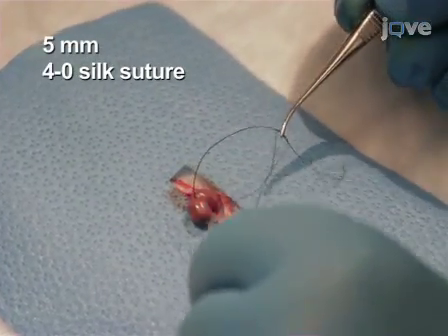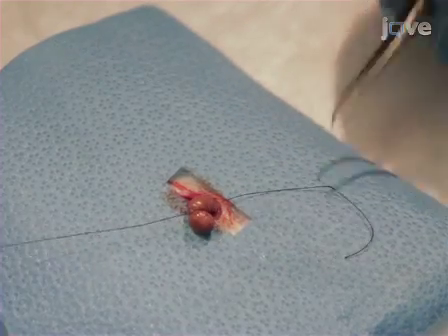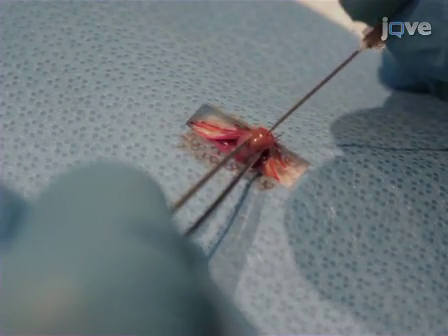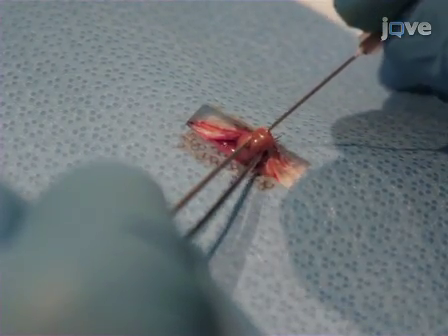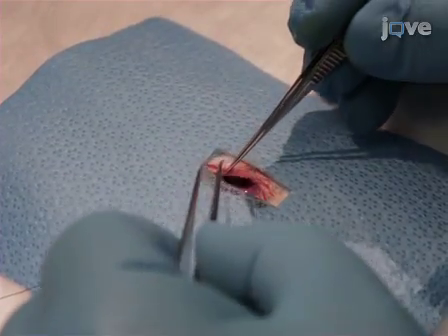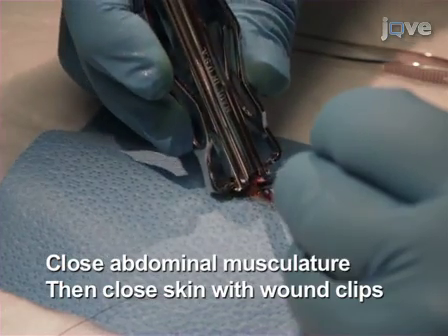Approximately 5 mm from the cecal tip, with a 4/0 silk suture, ligate the cecum, and then using a 22-gauge needle, puncture the ligated cecal stump once to allow extrusion of stool. Immediately return the cecum to its normal intra-abdominal position and close the abdomen.